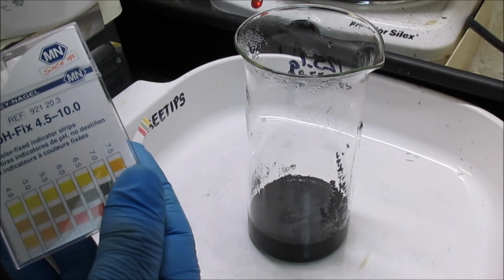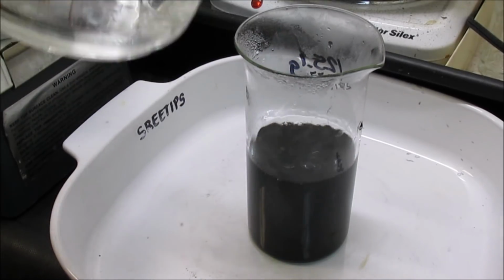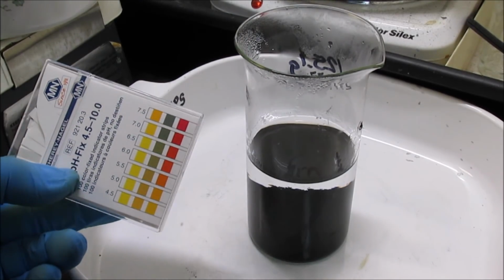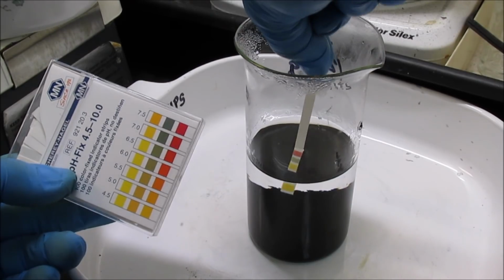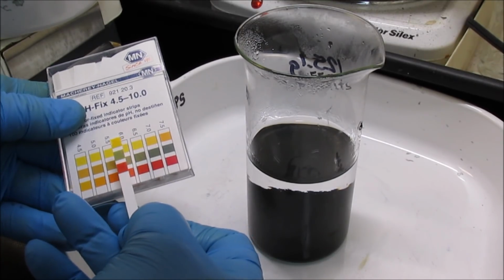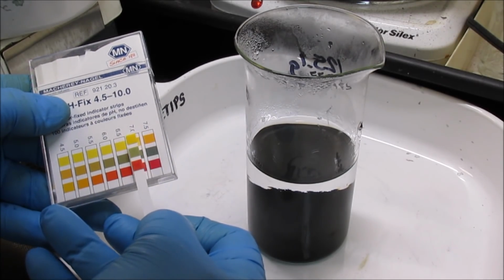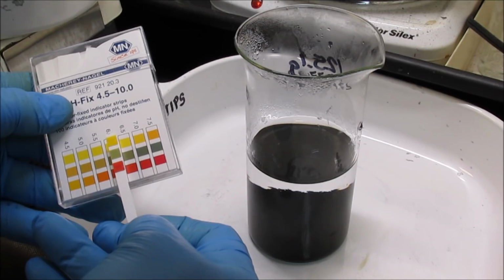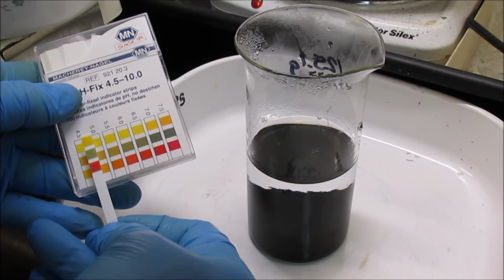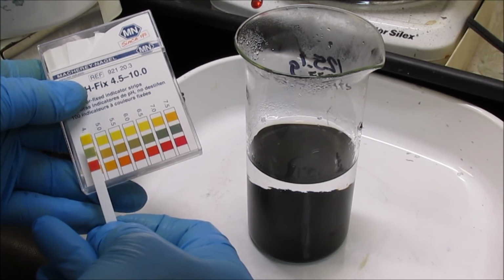Alright, this is rinse number 20. Hot distilled water rinse number 20. What I'm going to do is stick my little pH test strip down in there now. Should have it pretty close to neutral. And let's see, where are we at with this thing? I'm going to call it neutral. We're at pH 7, easy. Maybe just a little under. But I think we're going to be good here. It took 2,300 ml of rinses to get all the acid out of that solution.